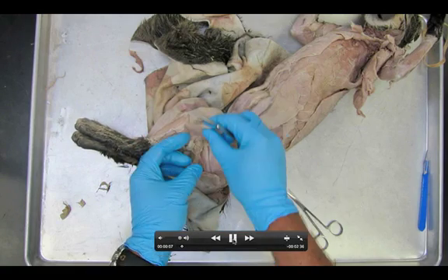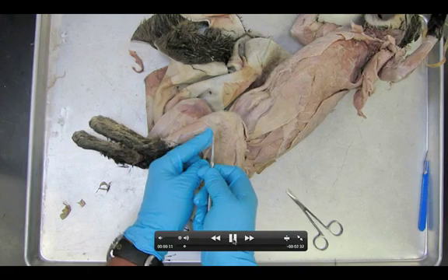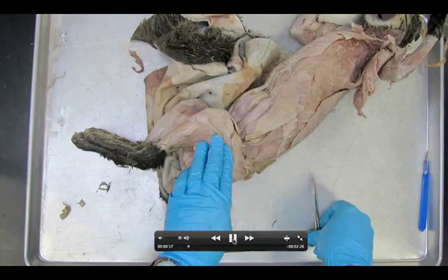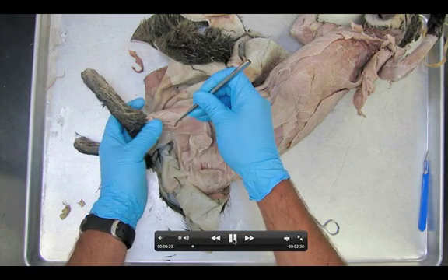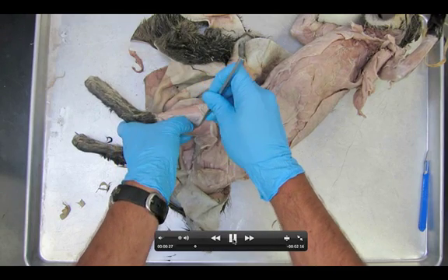Notice we are working on the same leg that we've been doing all of our dissections on. You can see me lifting up the biceps femoris there. We're going to start this by partially removing some of the attachment point of the biceps femoris. So we're going to lift that up, and there you see the gastrocnemius. Now we're looking at it from the other side — a very prominent, easy-to-find muscle on ourselves. This is our calf muscle.